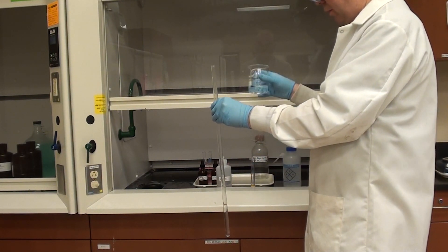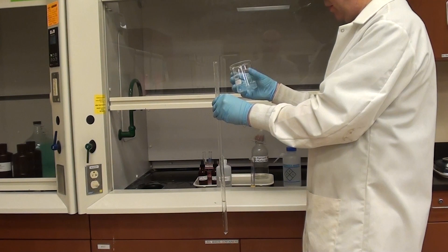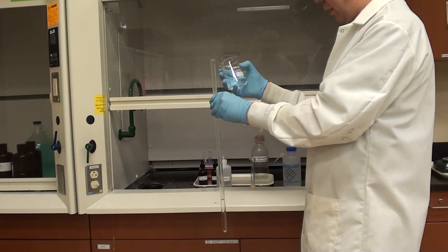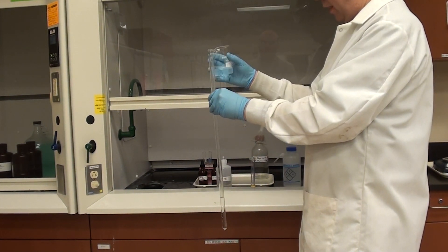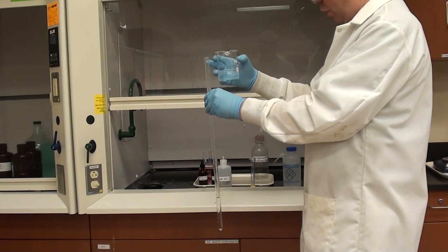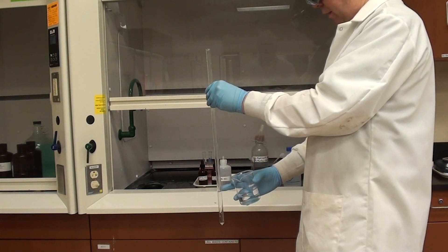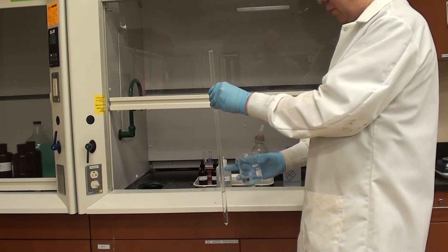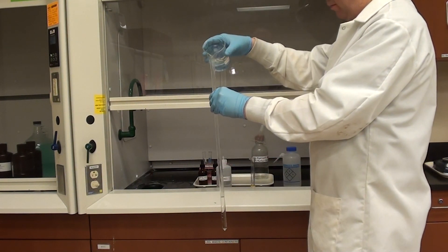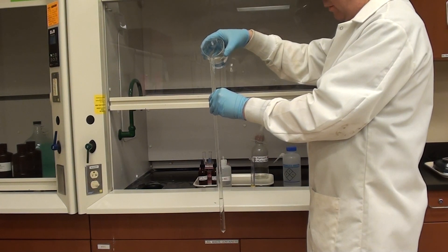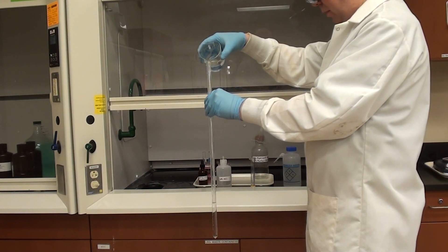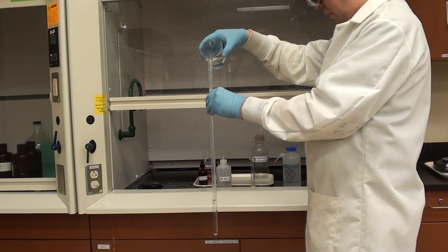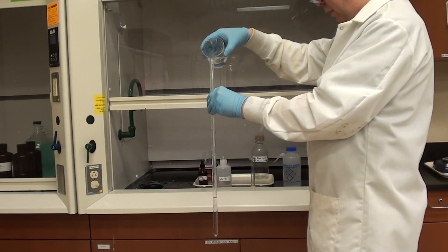What I'm going to do now is I've got some water here. It doesn't have to be DI water, tap water should be okay. And I'm going to pour that into the eudiometer tube so that the 6 molar HCl pretty much just stays on the bottom and doesn't mix too much with the water. Just kind of doing it down the side a little bit. Notice I angle it just a tad.